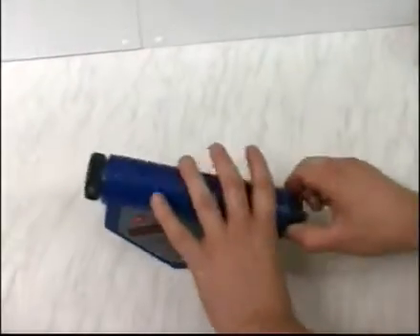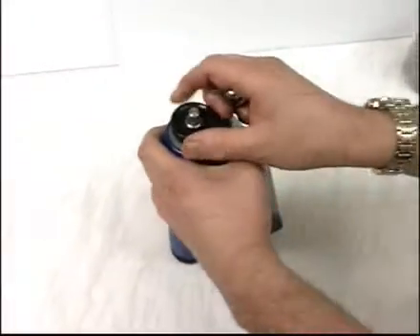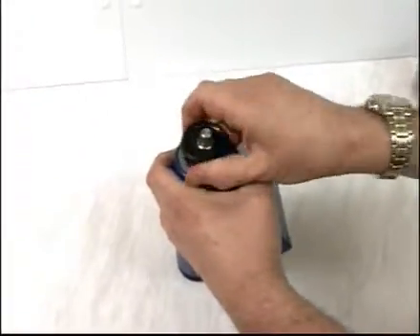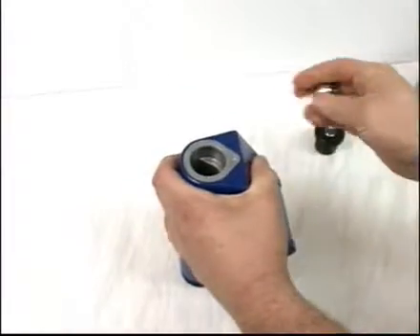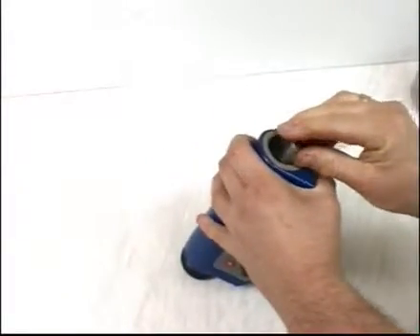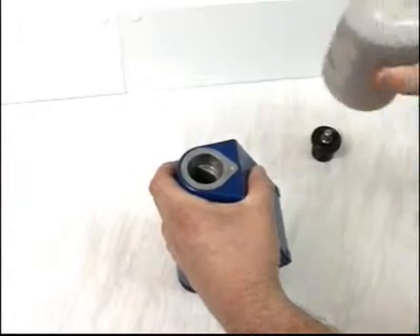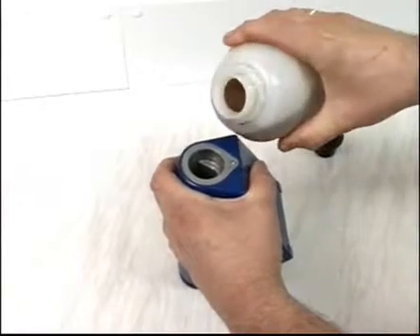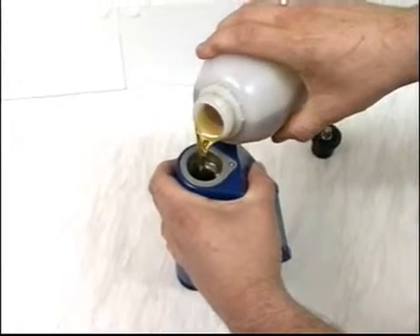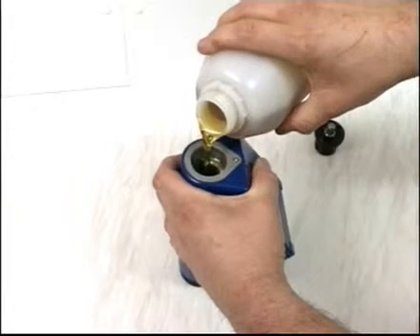To fill, hold the viscometer on its end, loosen the valve, and remove the plug from the tube. Make sure the tube is clear and clean and contains the metal ball. Fill it with the oil sample to just above the V-plate.